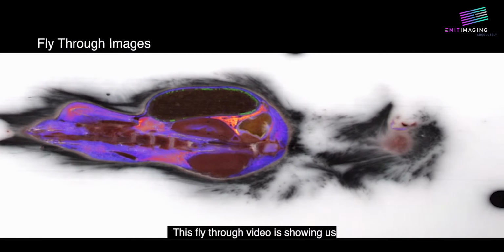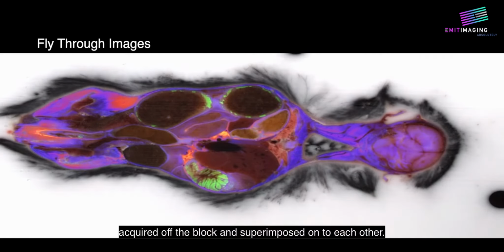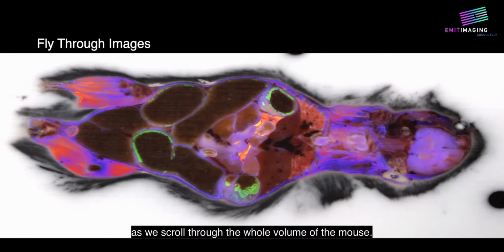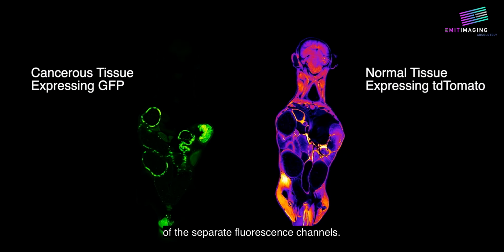This fly-through video is showing us slice-by-slice images as they were acquired off the block and superimposed onto each other. Green and red fluorescent channels can be seen overlaying on the color anatomical images as we scroll through the whole volume of the mouse. We are now showing fly-through videos of the separate fluorescent channels.